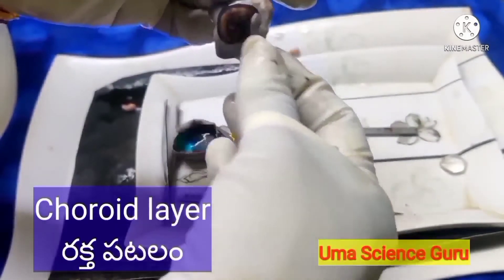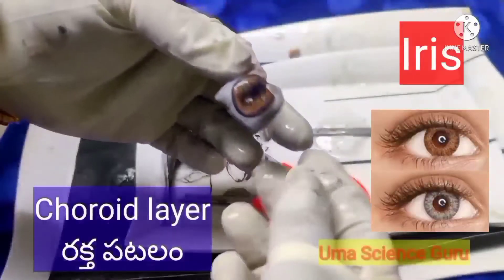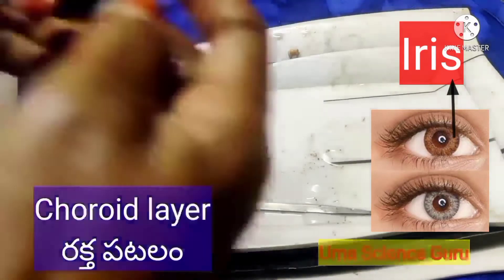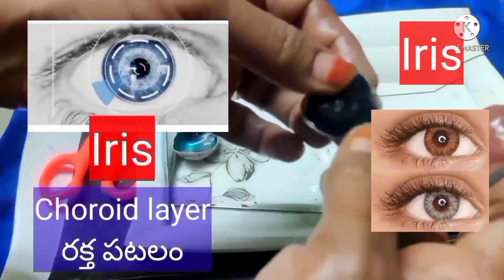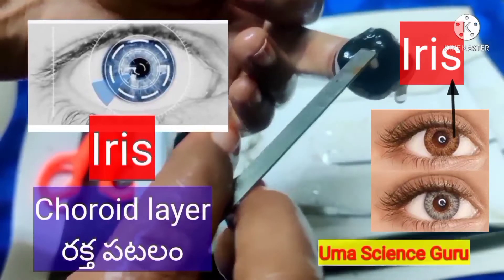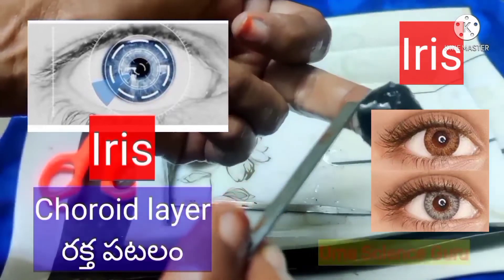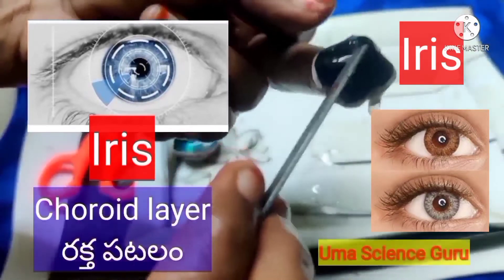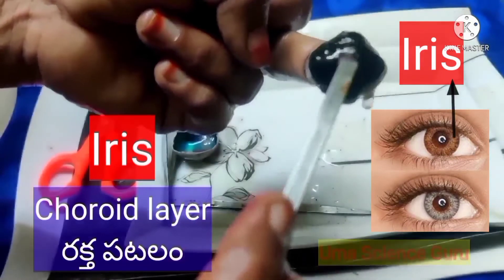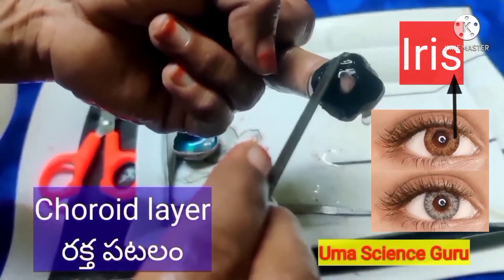Radial and circular muscles are present in the iris. Students, when issuing identity cards, they take photographs of your eyes. Do you know why? Because iris patterns are individual-specific and can be used for identification, just as our fingerprints. The color of the eye is determined by the color of the iris. The iris has a pigment which gives black, brown, and blue color to the eyes of individuals.